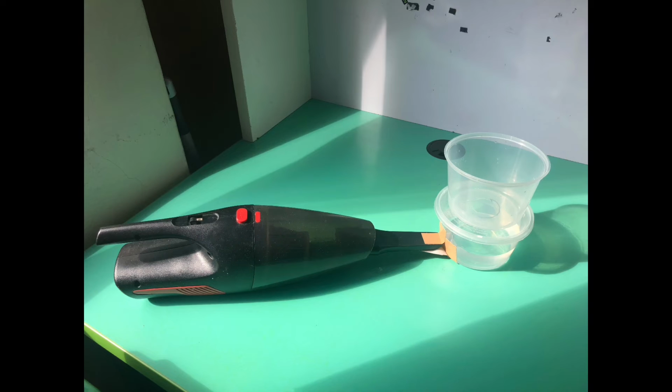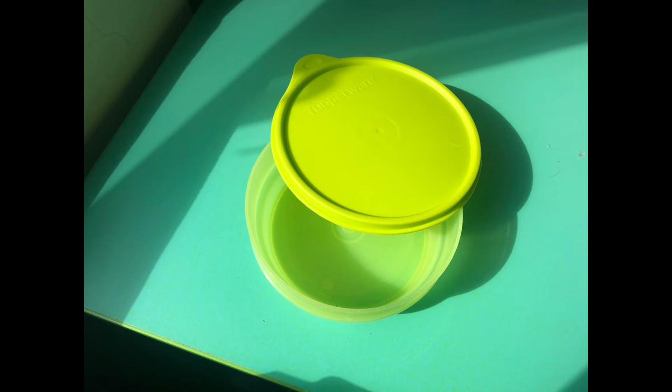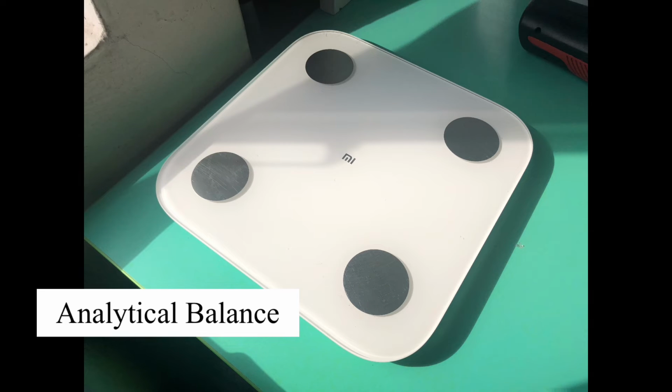Assalamualaikum and hi, I'm Ina and I'm going to show you how to conduct the total suspended solids test. First things first, I'm going to explain the equipment and materials that we need for this test, which are: vacuum filtration system, glass fiber membrane, aluminium dish, drying oven, desiccator, and analytical balance.